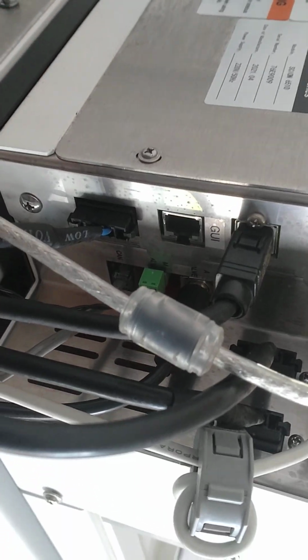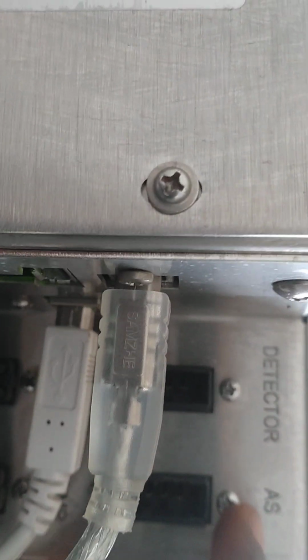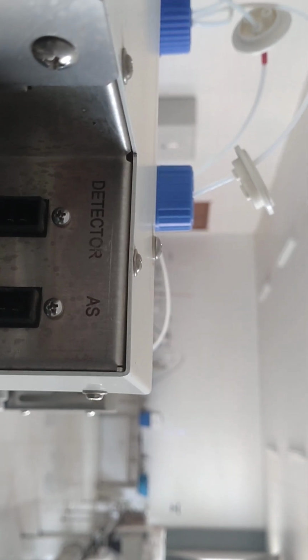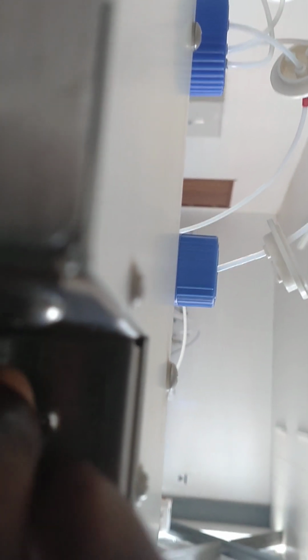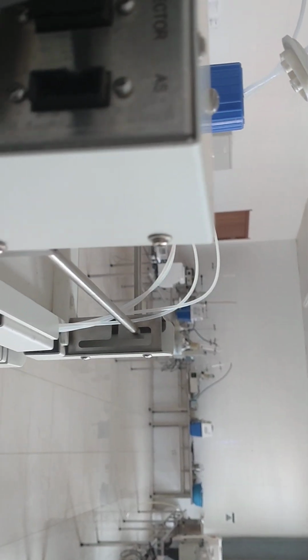Again, nothing changed. And we have where we could have put the autosampler, but we do not have an autosampler. So the detector here, there is nothing connected to this detector, but I don't know if we change it to this position, because it is still going to be the same. These places are for detectors.